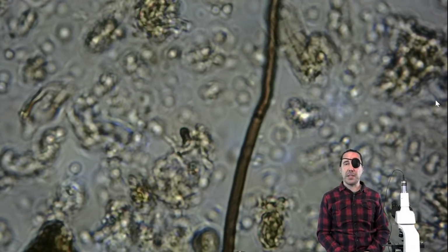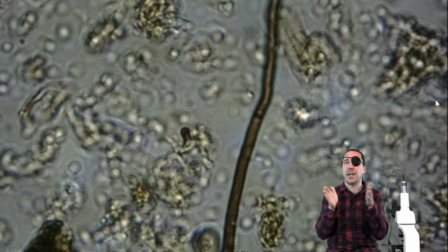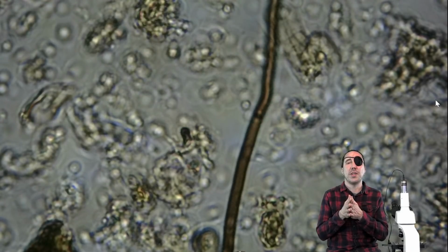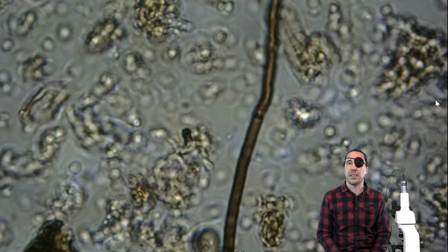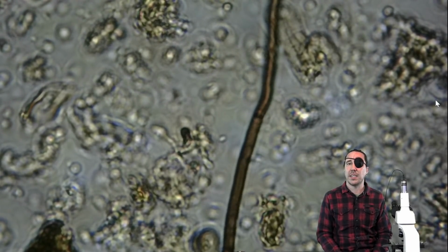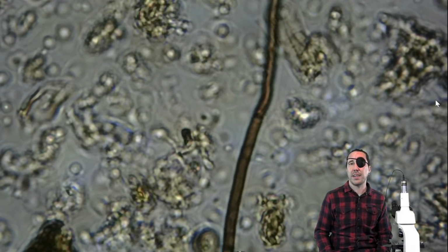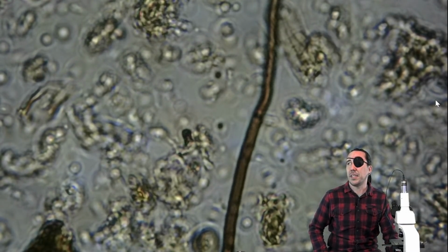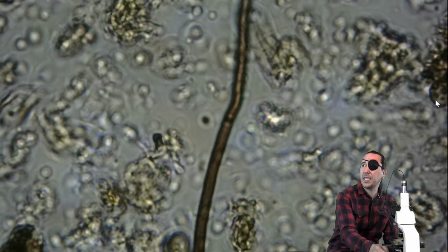And one thing I failed to mention earlier: when we're looking for fungi, I talked about the micrometers of width on a fungal hyphae. We were wanting to make counts or hoping to see fungi that are 2.5 micrometers or larger. Generally, it's been found that smaller, clear fungi are going to be what's called oomycetes, or pathogens that are going to be harmful to plants and soils. They're generally clear, thin, and they don't necessarily have uniform diameter, whereas beneficial fungi are going to be wider, like I said, 2.5 micrometers or wider, and darker in color, or at least not clear.